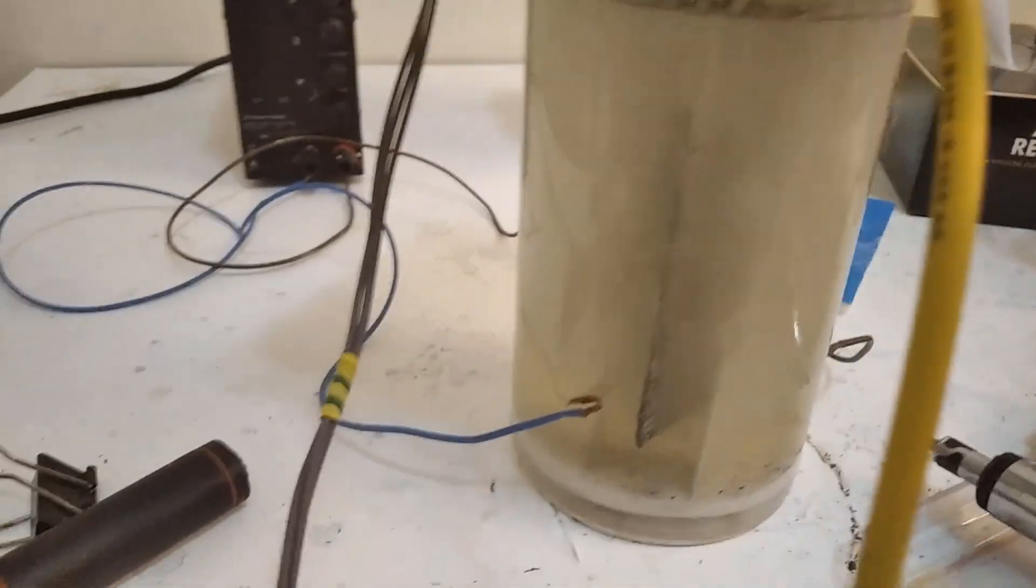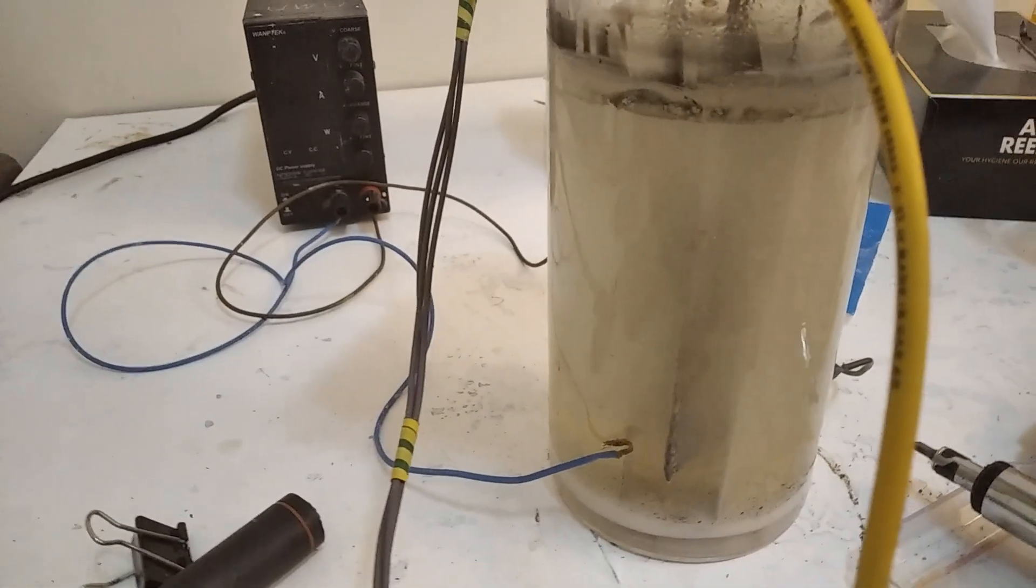This is 20 if you divide it by 1.43, which is the resistance of the shunt. This would be 20 amps.